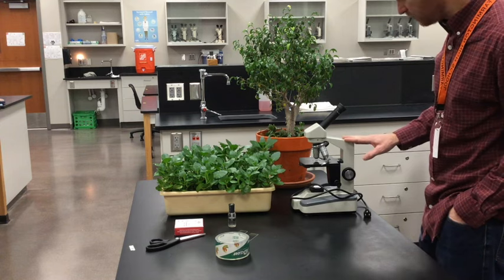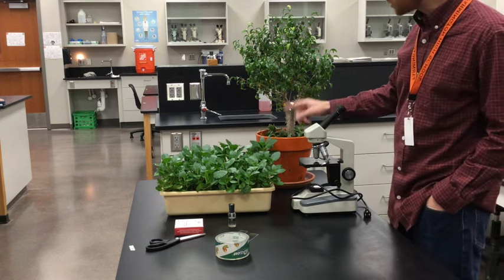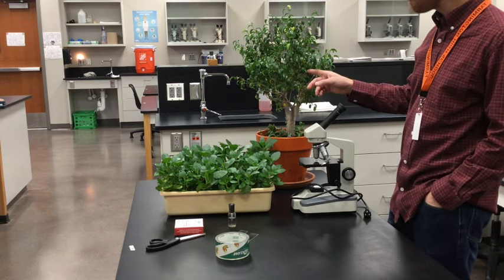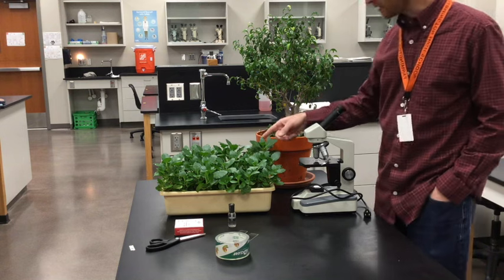Here's the equipment you'll need. A microscope, also a source of leaf. So here I've got in the room right now I've got a ficus, and I've also got a succulent.